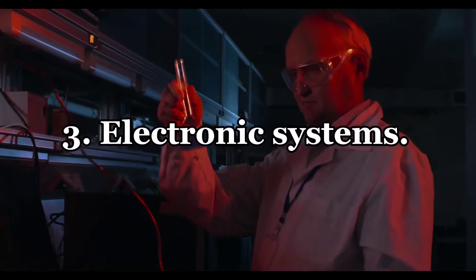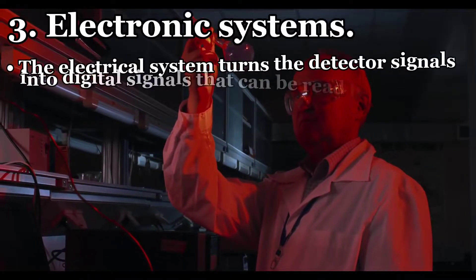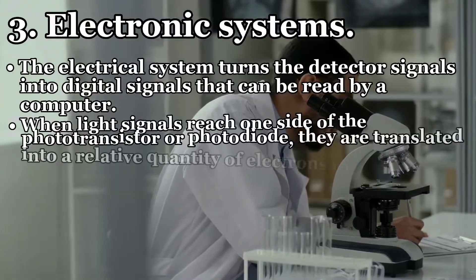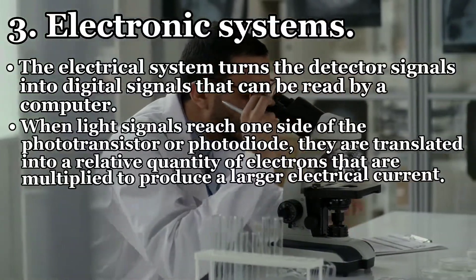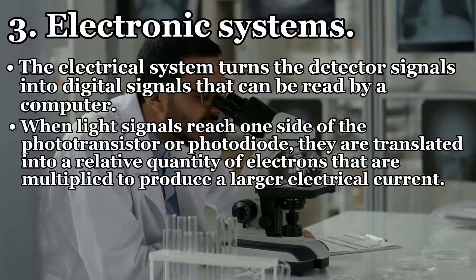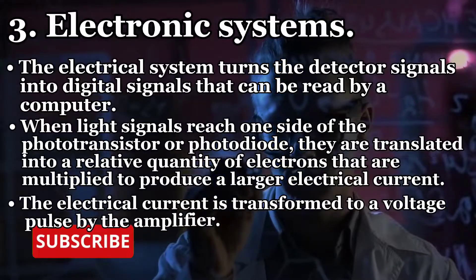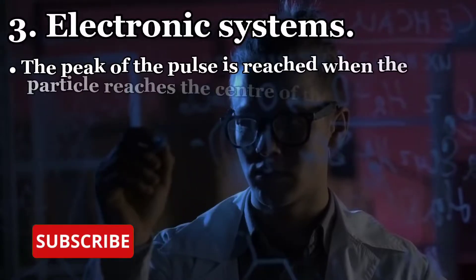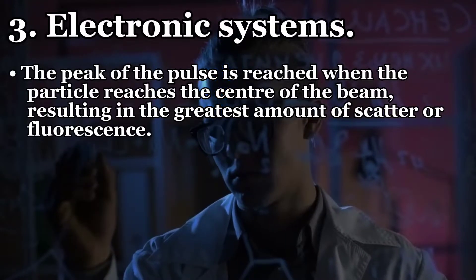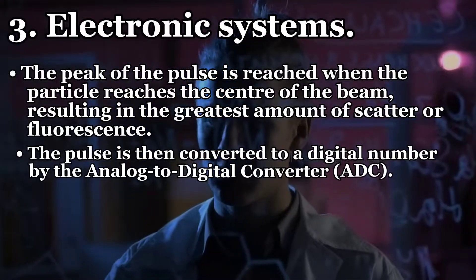Lastly, let's learn the function of the electronic system. The electronic system turns the detector signals into digital signals that can be read by a computer. When light signals reach a phototransistor or photodiode, they are translated into a relative quantity of electrons that are multiplied to produce a larger electrical current. The electrical current is transformed to a voltage pulse by the amplifier. The peak of the pulse is reached when the particle reaches the center of the beam, resulting in the greatest amount of fluorescence and scatter. The pulse is then converted to a digital number by the analog-to-digital converter (ADC).